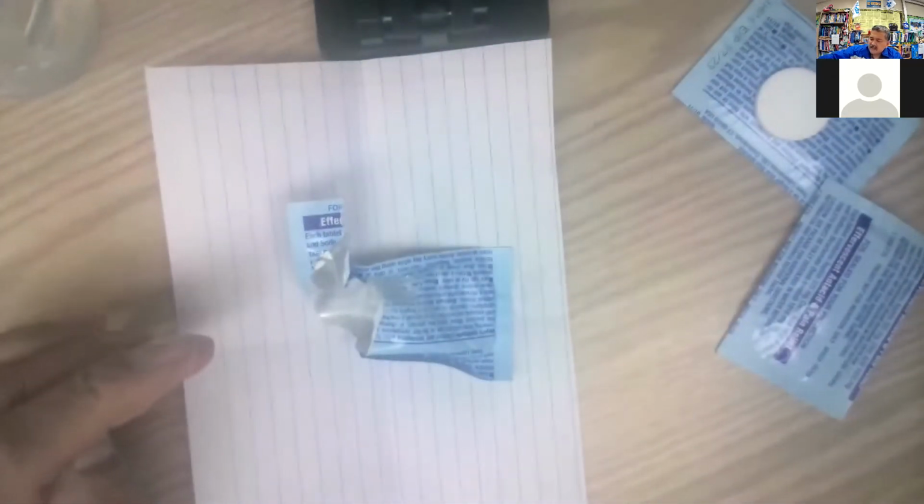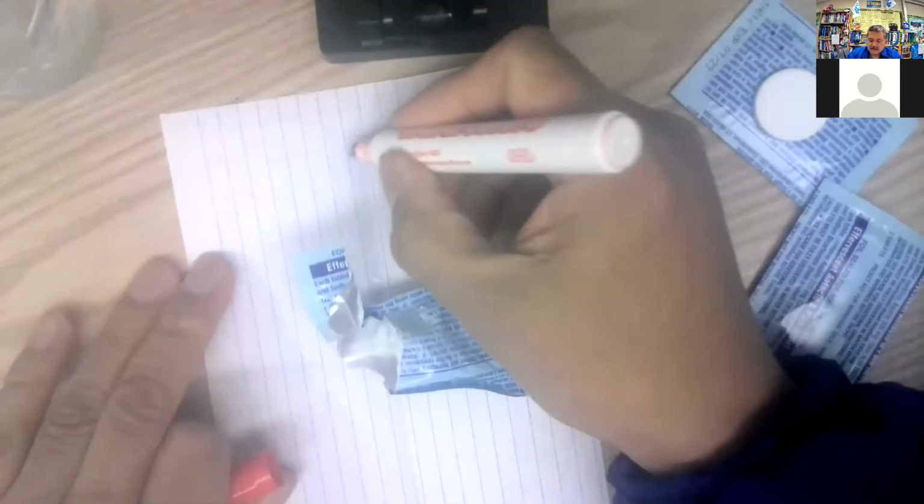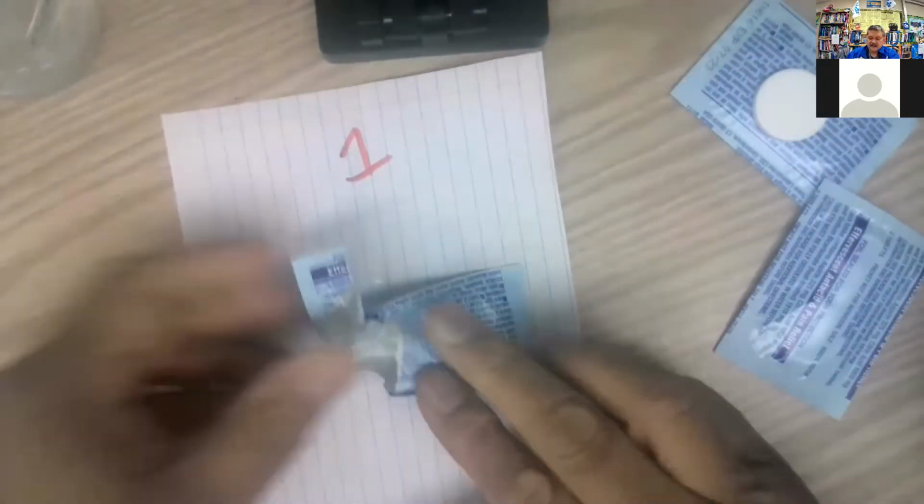So that's my ones. And so let's see. Go ahead and mark them. And put more on this. Close that up so that I can use that. Try to keep the powder. I'll do a 2 and a 3. With the 2s and the 3s, I can do it in the package, right? So let's crunch it out.